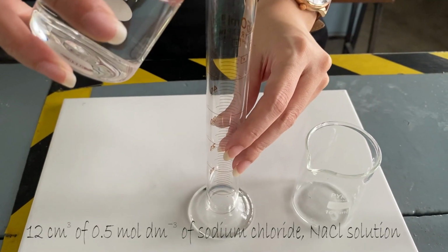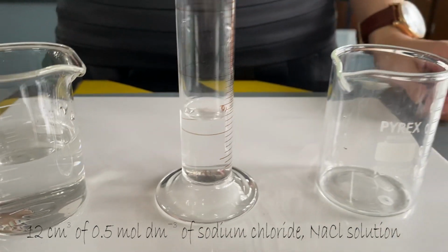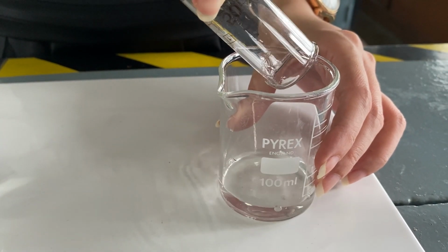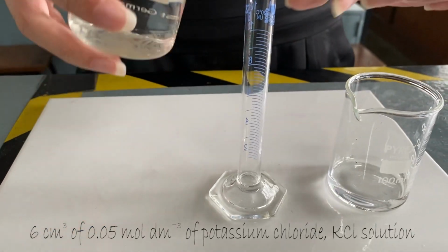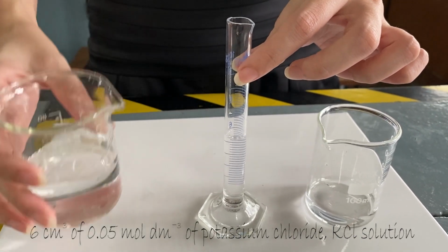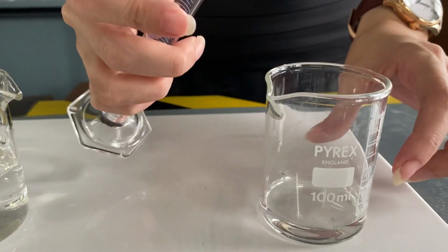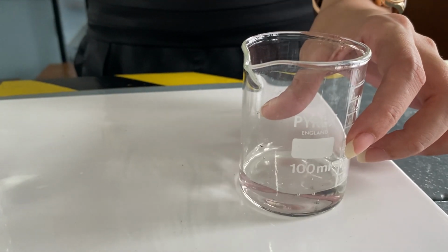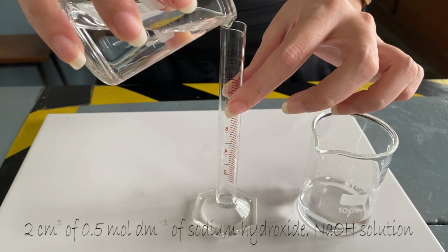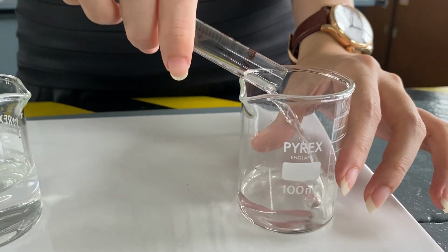Next, measure 12 cm³ of 0.5 mol per dm³ of sodium chloride solution and pour it into a beaker. Then measure 6 cm³ of 0.05 mol per dm³ of potassium chloride solution and pour it into the same beaker. Lastly, measure 2 cm³ of 0.5 mol per dm³ of sodium hydroxide solution. Pour it into the same beaker.